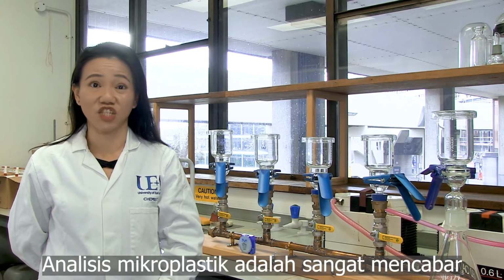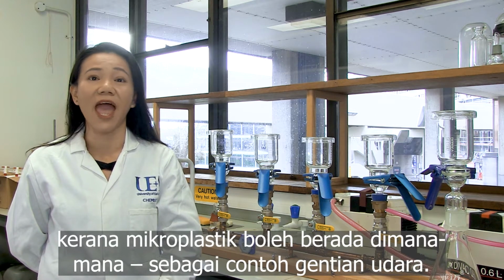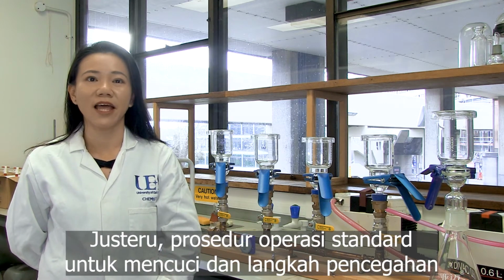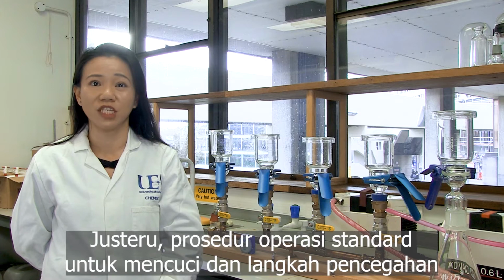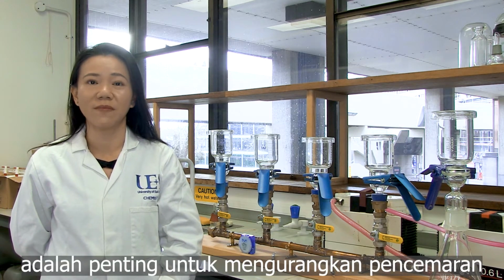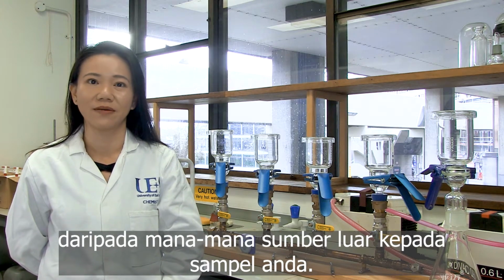Microplastic analysis is challenging because unknown microplastic particles could be everywhere, for example, airborne fiber. Therefore, standard operating procedures of cleaning and precaution steps are important to minimize contaminations from any external source to your sample.